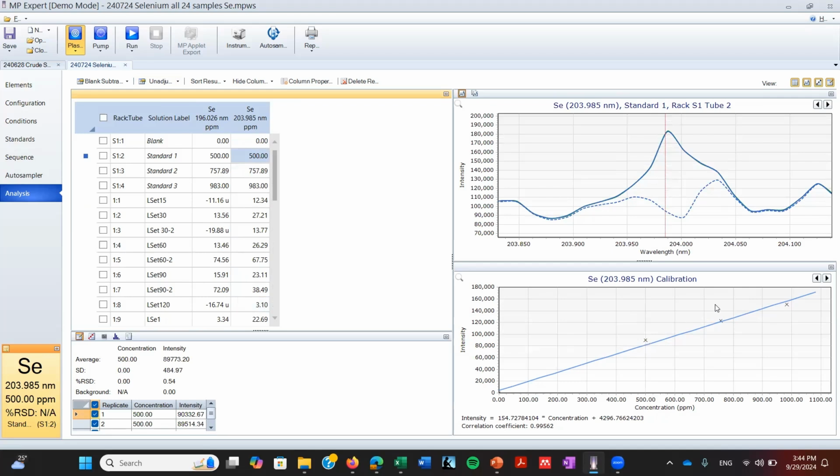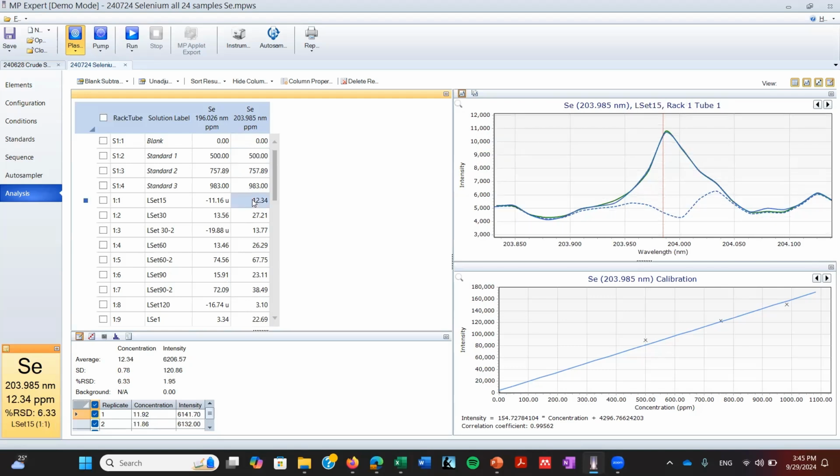So as I said before, we don't have a completely linear relationship between the intensity and the concentration. But if you have three standards that are relatively close together, you can expect them to describe very accurately the actual concentration that you are having. Therefore, to have a very objective way to discriminate valid and not valid data, we are going to say that any data between the lowest standard and the highest standard is going to be valid. So in this case, we have 500 ppm as the lowest standard and 983 ppm as the highest standard. So as you can see, maybe this data wouldn't be good to be considered valid data because it's very low in comparison to these three standards.